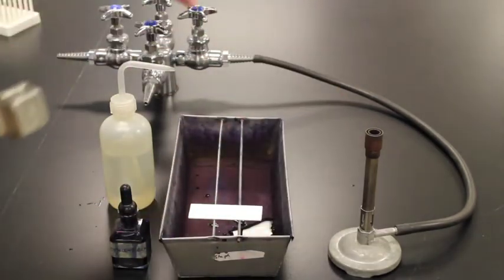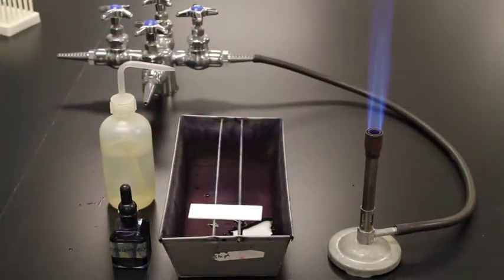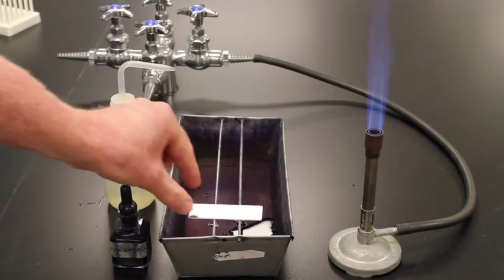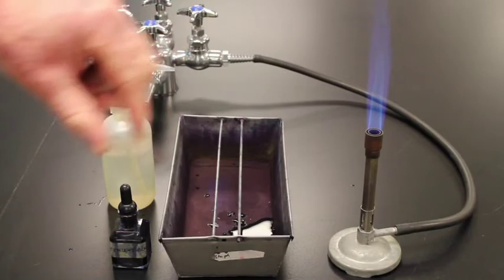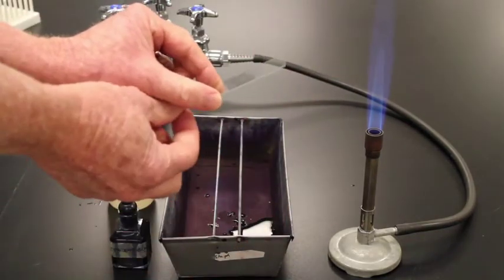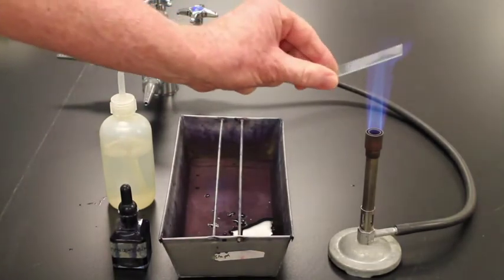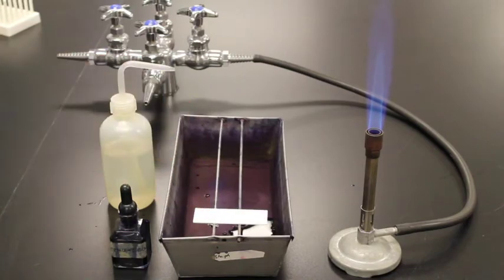So to start with, I'm going to light the Bunsen burner. Okay, we'll get a nice flame going. You see that nice cone on that Bunsen burner there. I'm now going to take my slide. I'm going to go over slowly twice over this slide, counting 1 Mississippi each time. I'm going to angle the slide away so when the flame hits it, it goes that way. A lot of people use clips so that they are a lot farther away from their fingers. So we're just going to go 1 Mississippi, 1 Mississippi, and put that there.